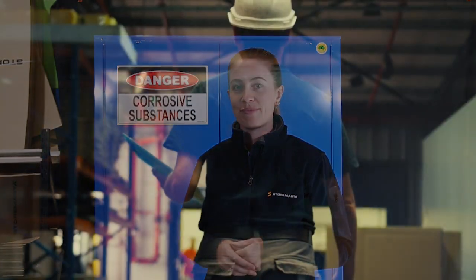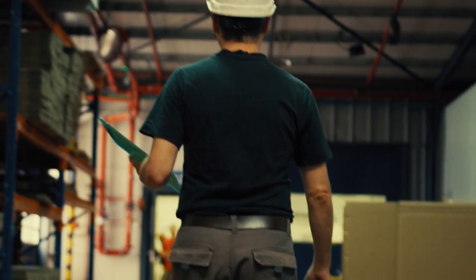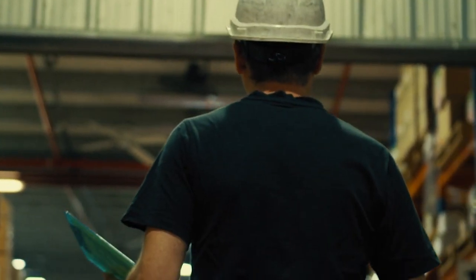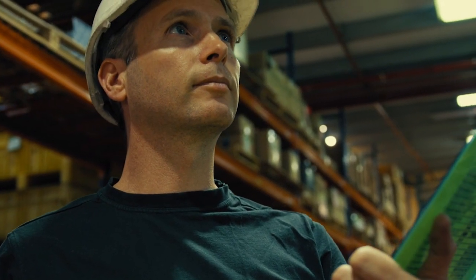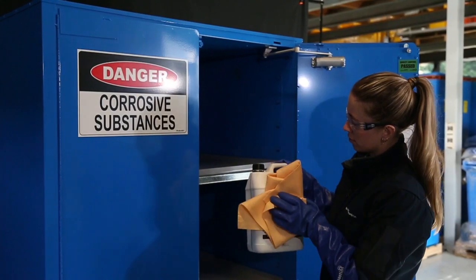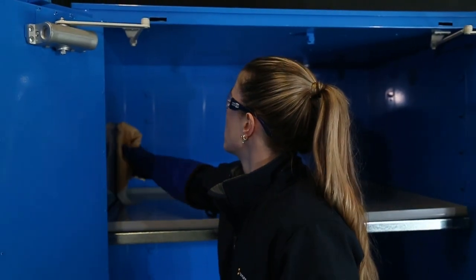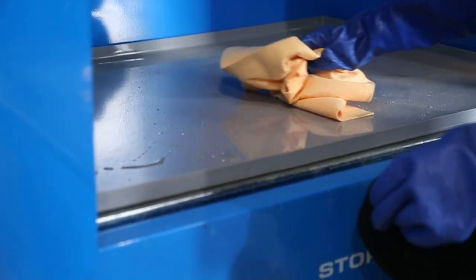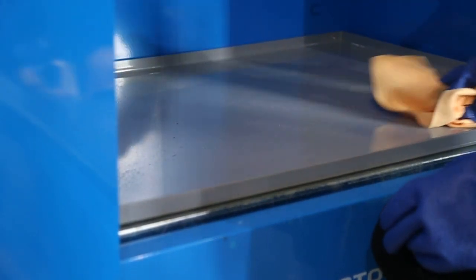from chemical spills. Routine inspections and maintenance are important in the longevity of your corrosive chemical cabinet. Firstly, you should have an inspection checklist for your corrosive store, as damages or changes in practice may affect your corrosive cabinet performance. The checklist should include a range of housekeeping duties, including but not limited to wiping down all chemical containers being stored, regularly wiping down the shelves, walls and ceiling of the cabinet, and cleaning out the spill sump in your cabinet as soon as the spill occurs. This is a requirement of the Australian standard.